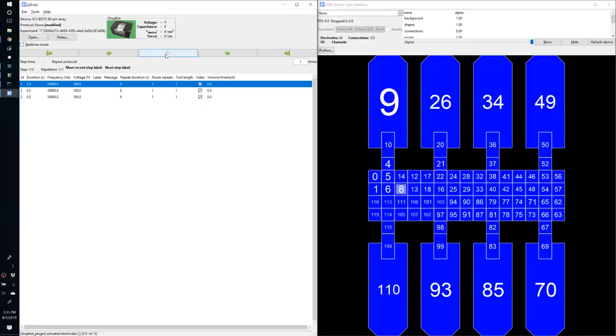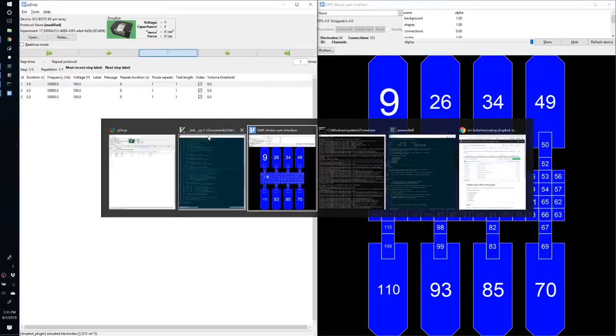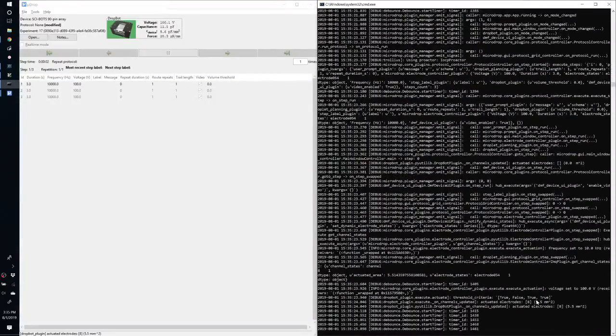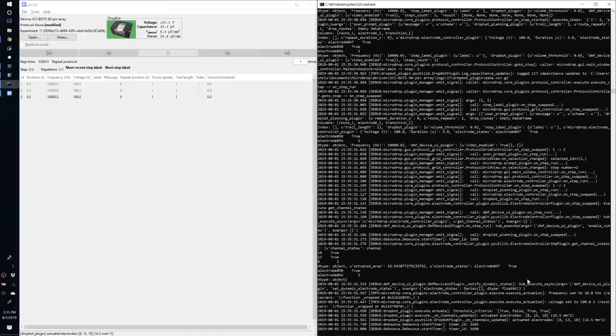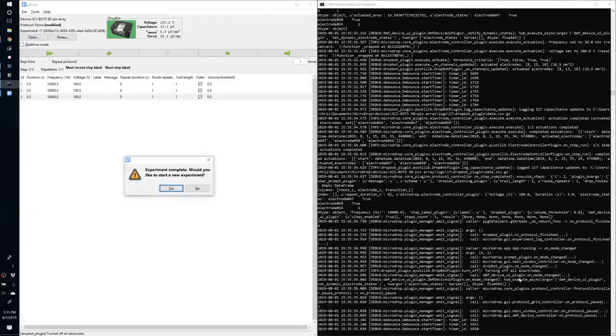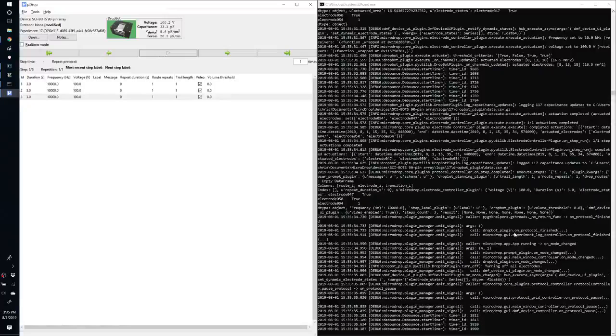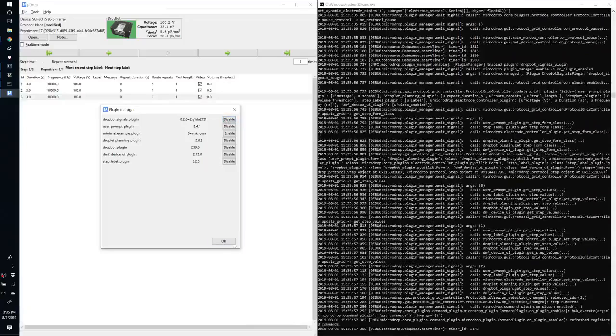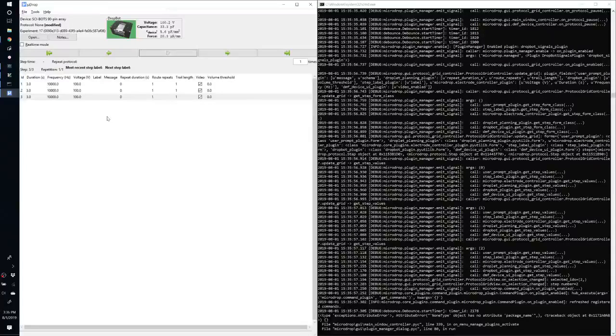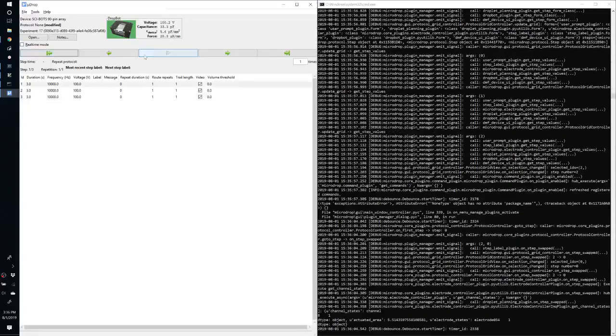Then we'll go to our first step, and we'll press play, and now go look over here. It might be difficult to see while this is running, but we'll go back and we'll look at the log afterwards here. Okay, so the experiment has completed, protocol has finished running, and now we'll go back and look for our messages. I forgot to do a step here, which is we need to enable our plugin. So that's under File, Plugin Manager, enable our plugin, and now we'll try to run it again.